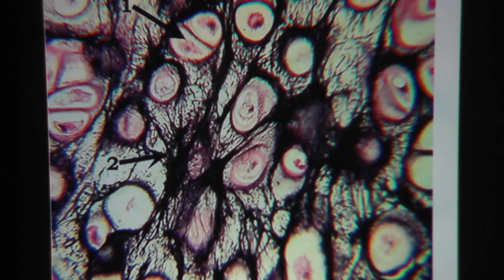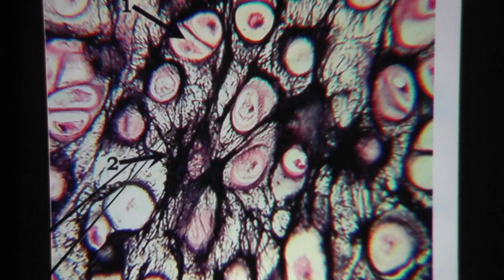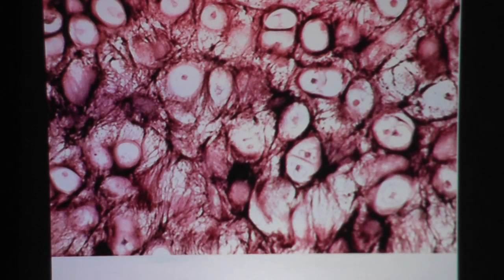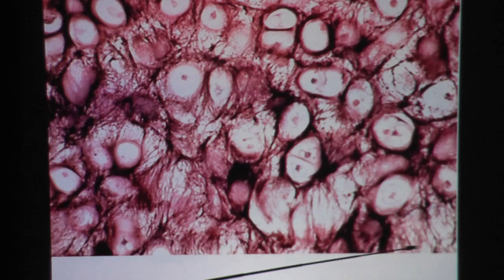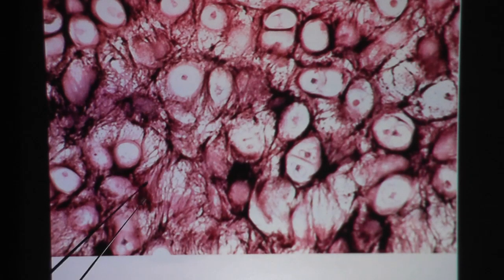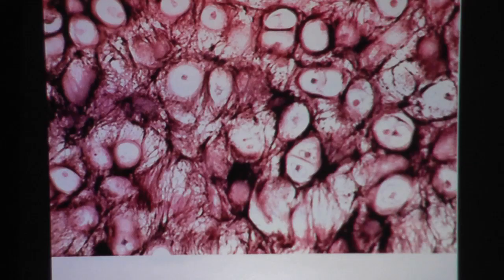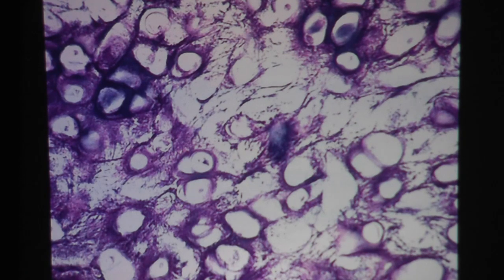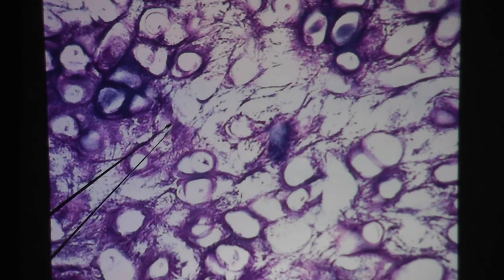Another view: number one is pointing to the chondrocyte in the lacuna, and number two is pointing to these dark lines — that would be the elastic fiber. Notice how dark the matrix is, and notice the randomness of these short little elastic fibers — these short little lines with no unique or distinct direction. They're scattered all over. You should clearly see the chondrocytes in lacuna. Notice the large cells, the chondrocytes in the lacuna, and then outside the cells in the matrix are the short dark elastic fibers.